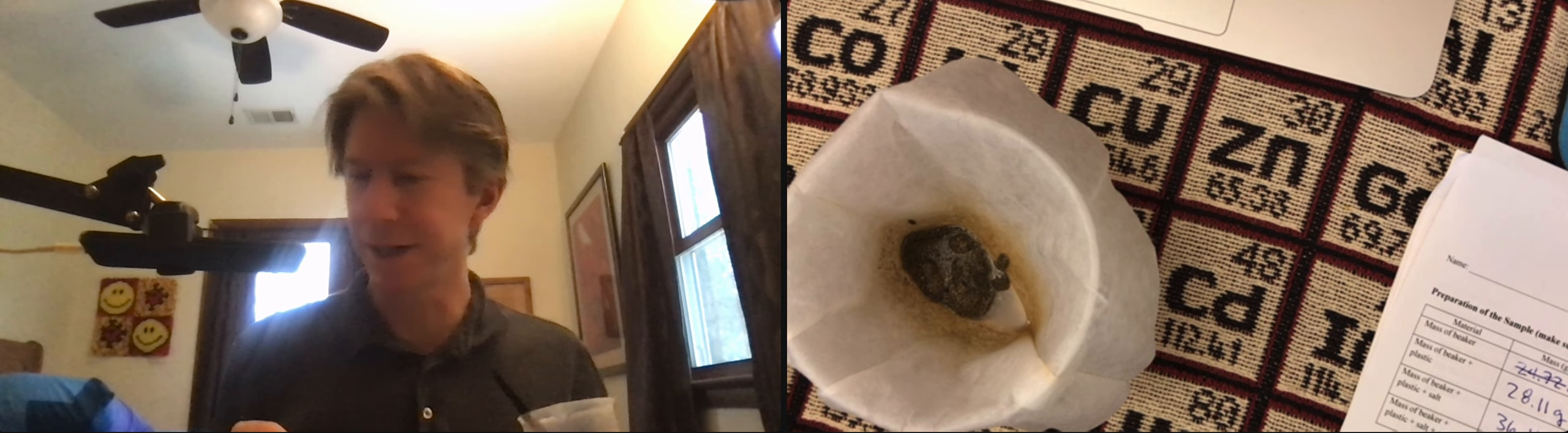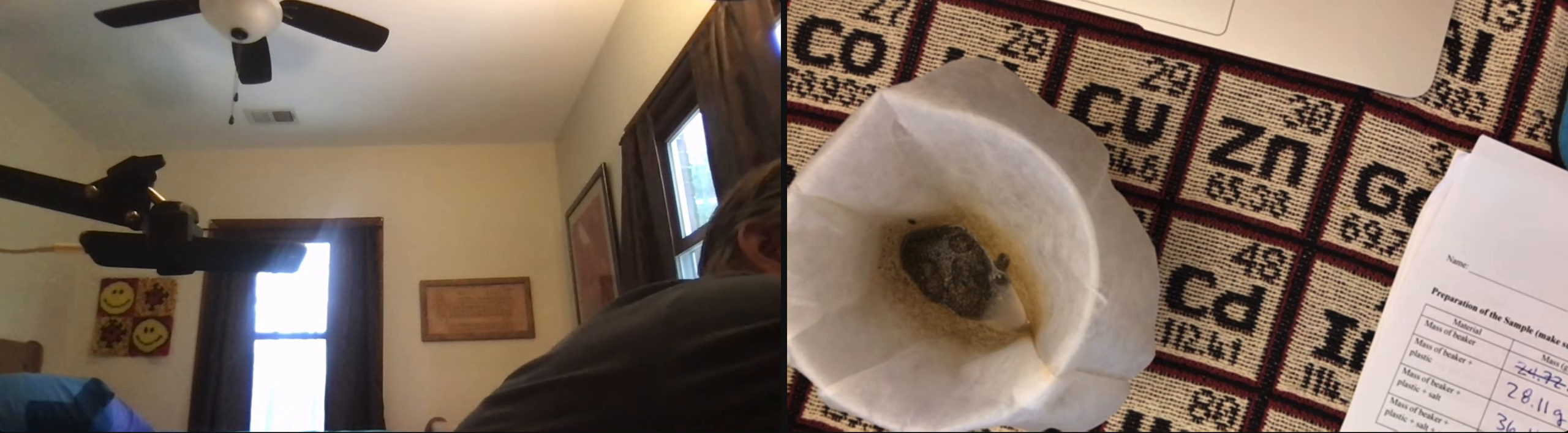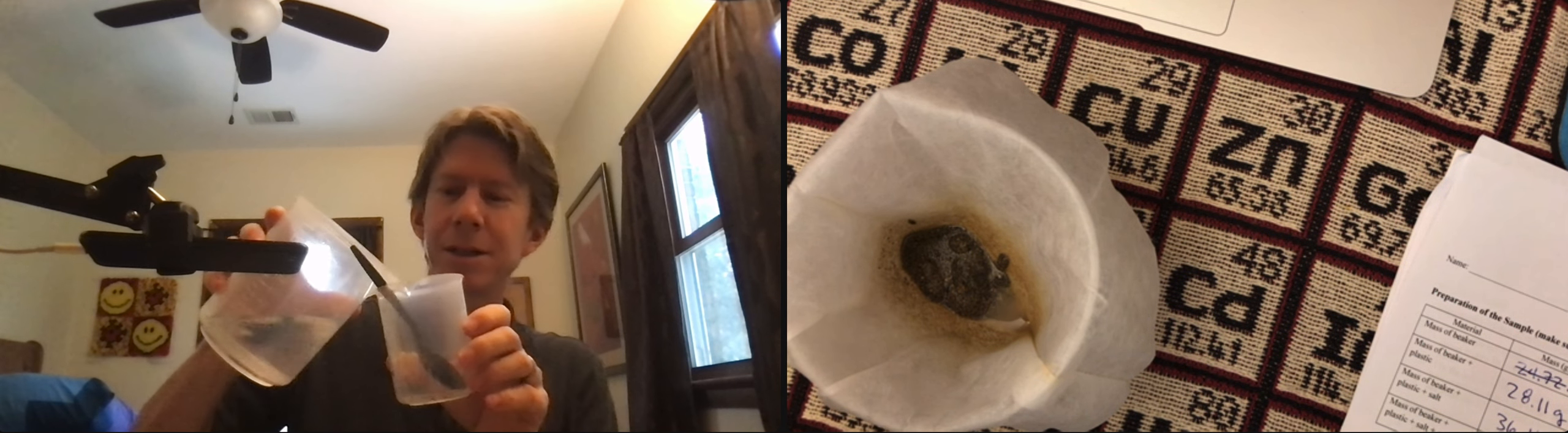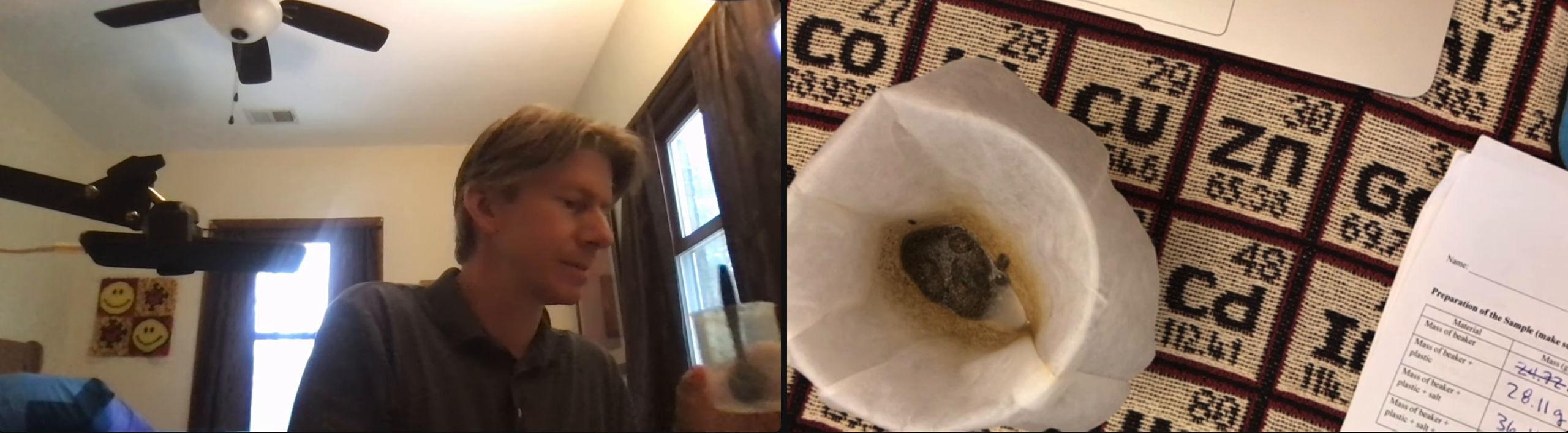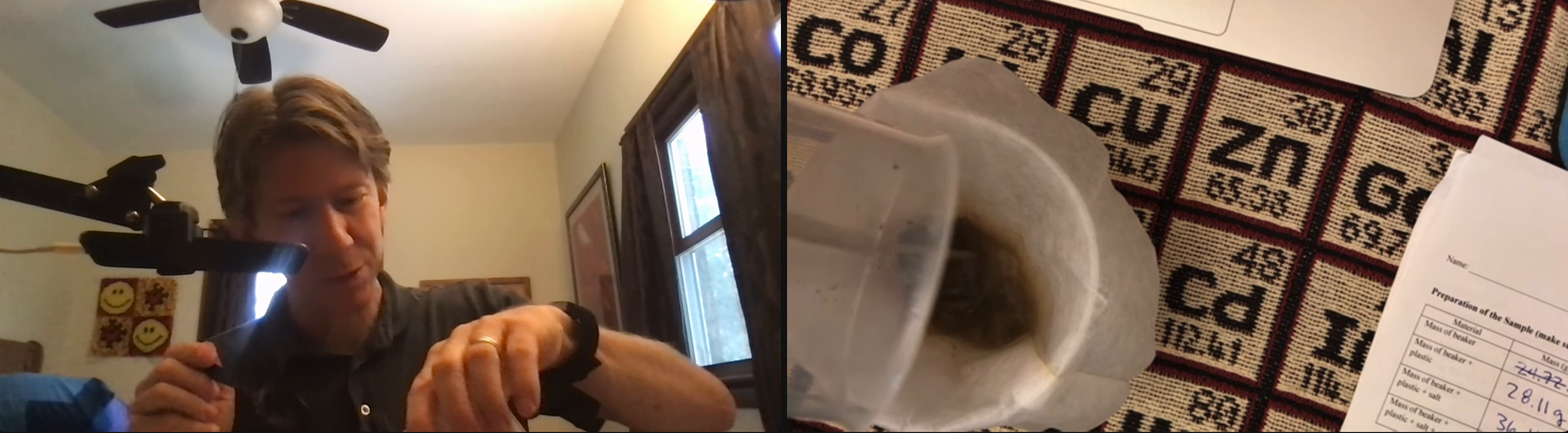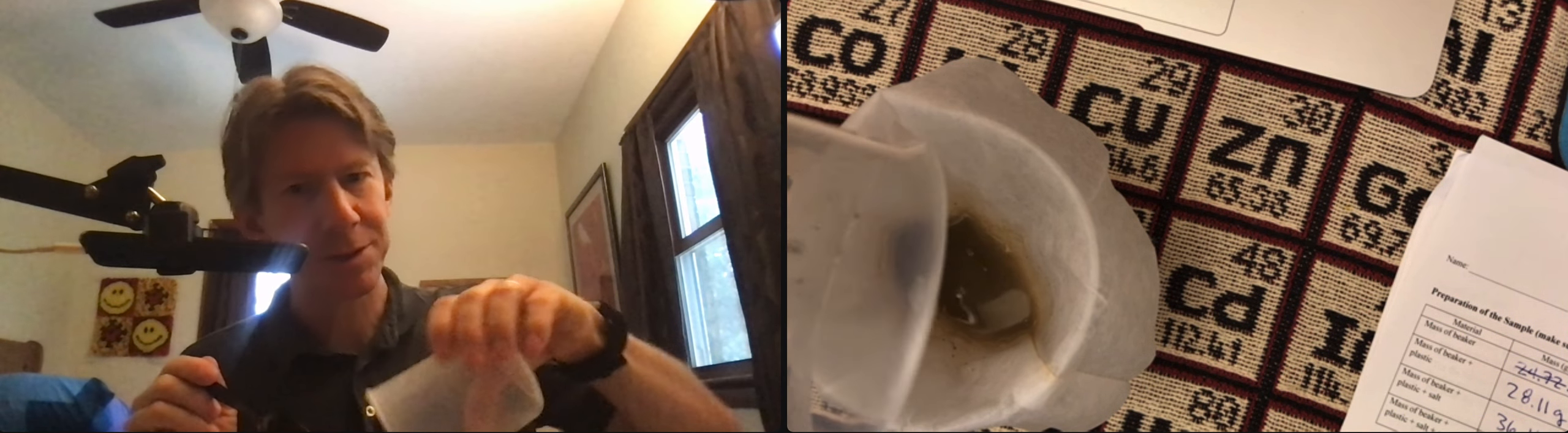Rinse the beaker with three small amounts of water. And this is just to get the rest of the sand to go over. So just a little bit. Again, exact amount doesn't matter. I'm swirling and I'm pouring. That was my first one.